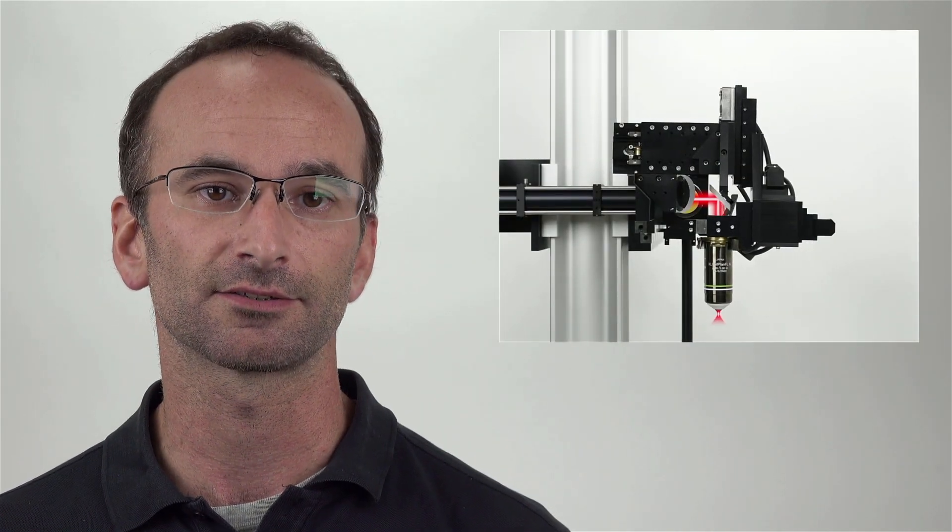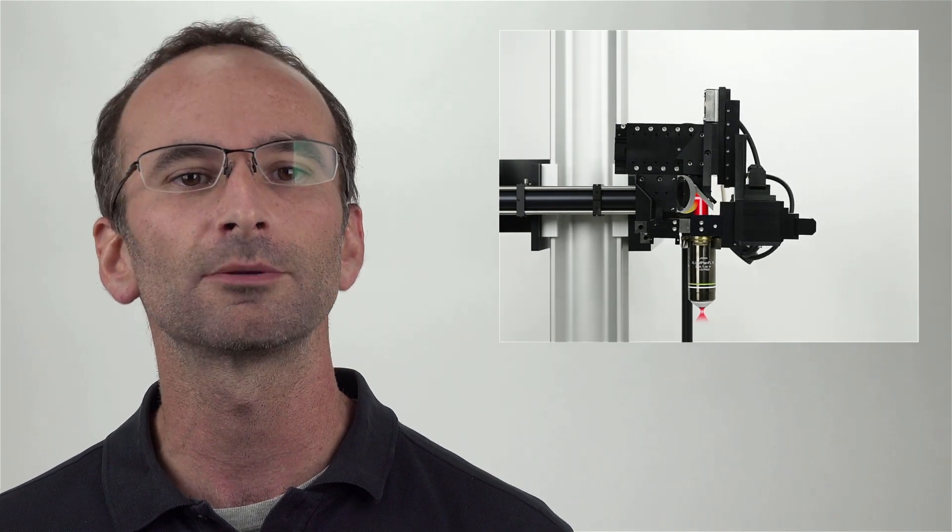Hi, my name is Jeff Lambright, and I'm going to walk you through the steps to align a Sutter two-photon imaging system, particularly a Sutter movable objective microscope.